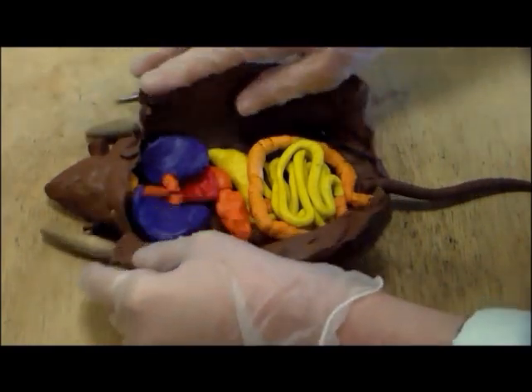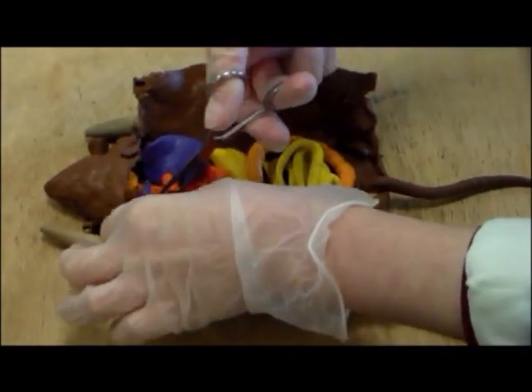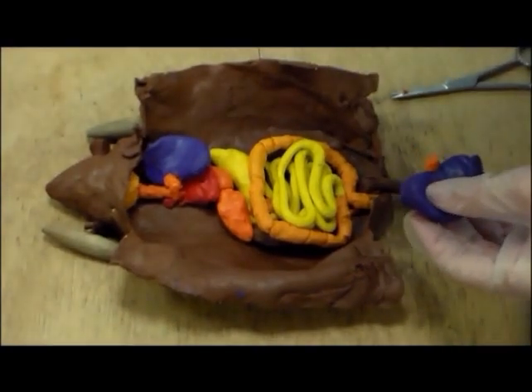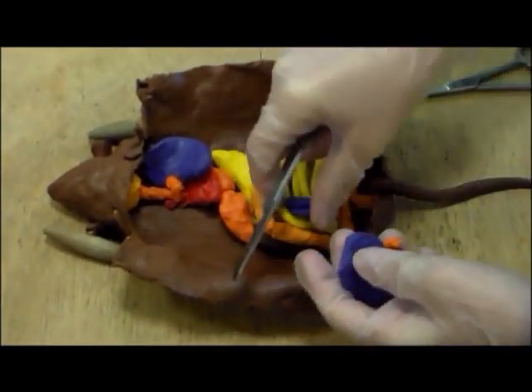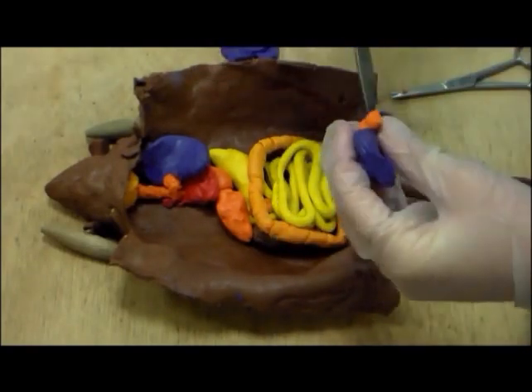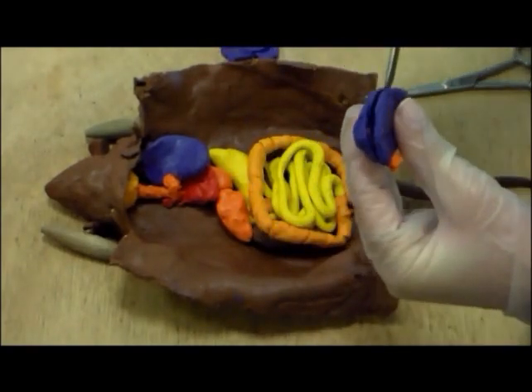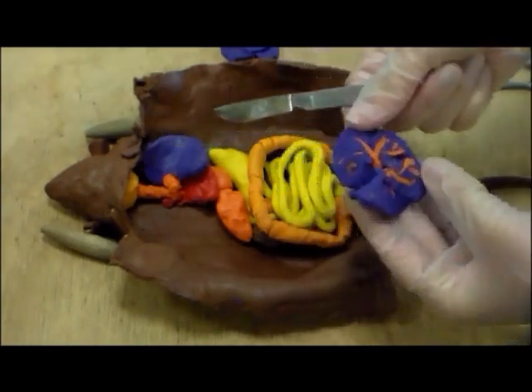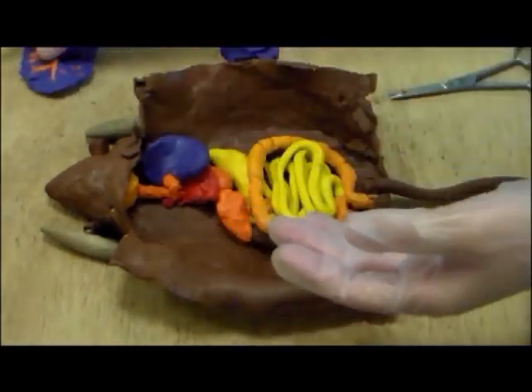Now you can see the anatomy of the rat. Here is the right lung. What's been cut off now is the anterior lobe and the posterior lobe. As you cut through the lung you will see the bronchi and the bronchioles.